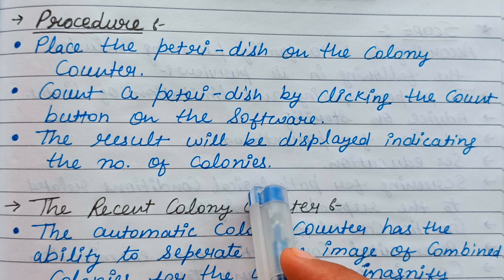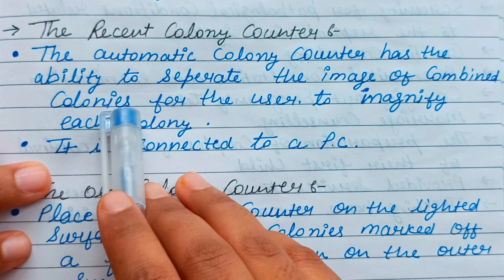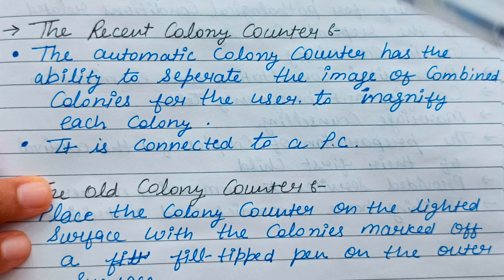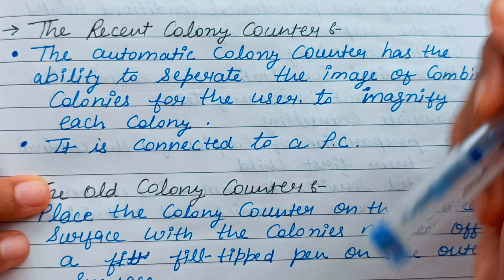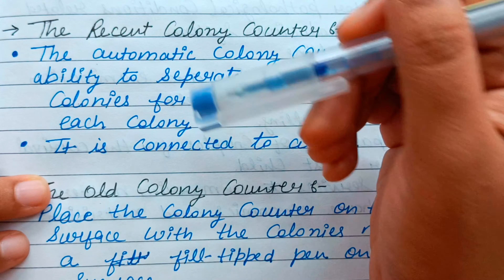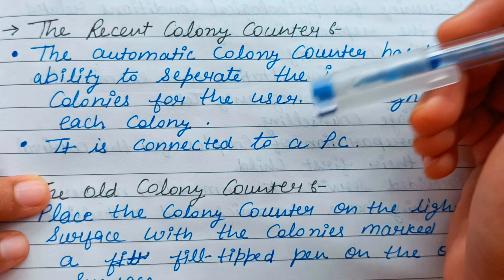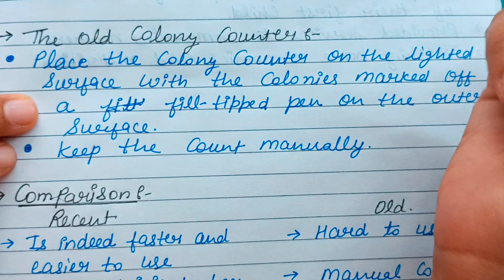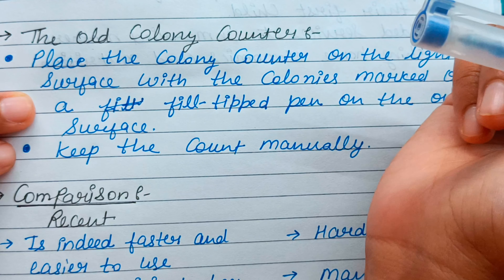The number of colonies present will be displayed. The recent automated colony counters have the ability to separate the images of combined colonies for the user, and magnify each colony. The counter is connected to a PC, which shows each colony of different types as separate images, so you can know exactly which colony is growing.